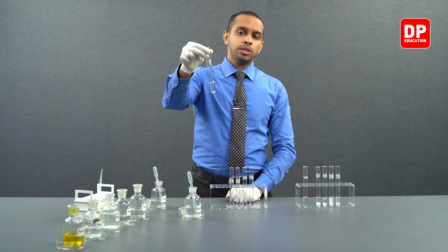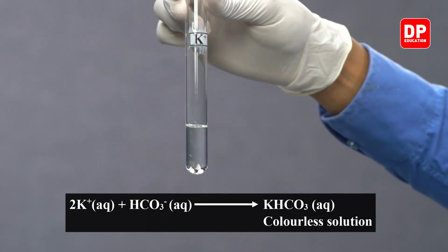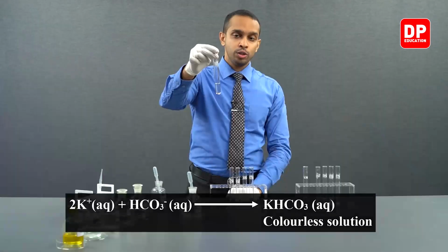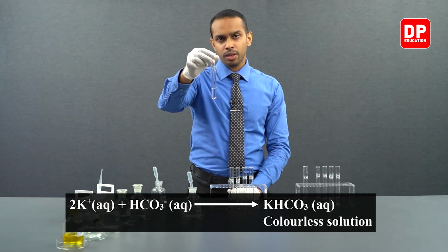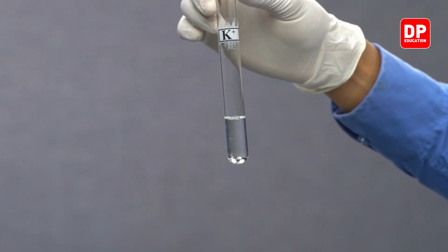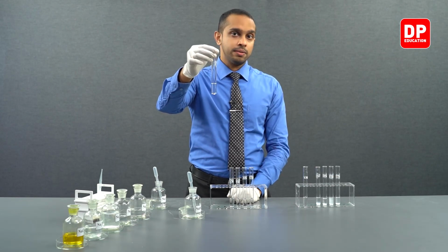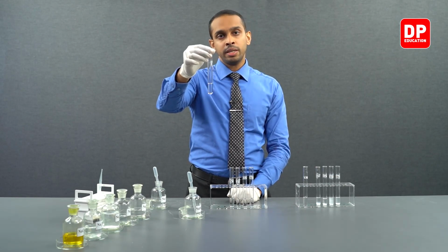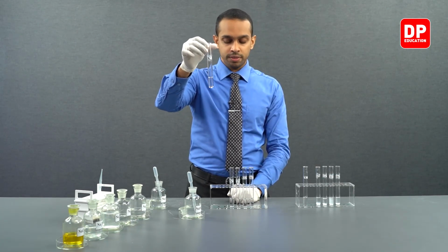So now this solution contains potassium ions as well as bicarbonate ions. You can see the formation of potassium bicarbonate. Potassium bicarbonate is water soluble, and no precipitate is observed.